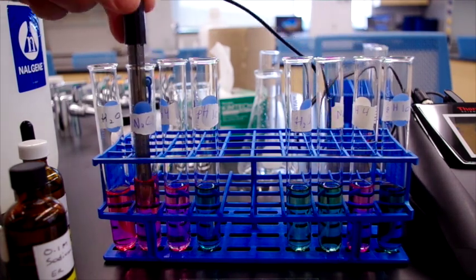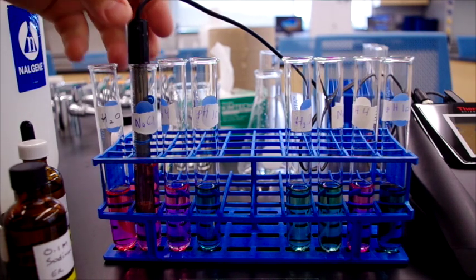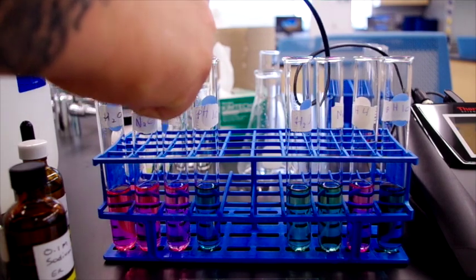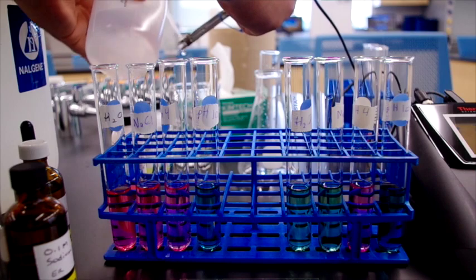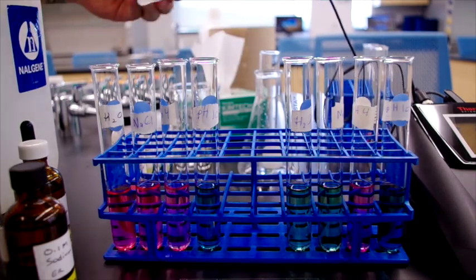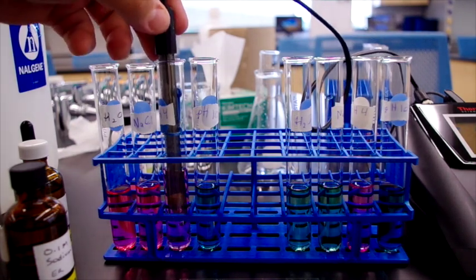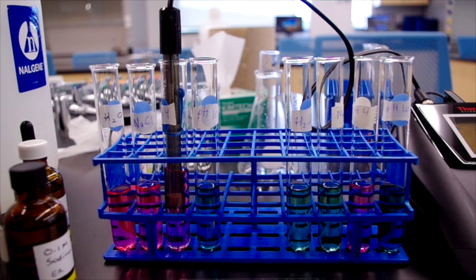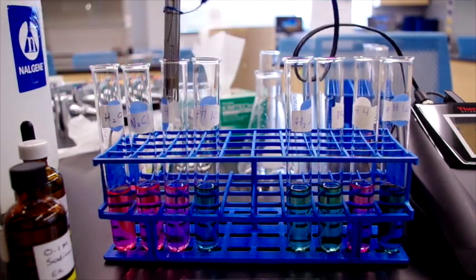And the sodium chloride solution has also gone down to a pH of about 2.4. The pH 4 buffer is sitting right around 3.55, so it has resisted the acidification.